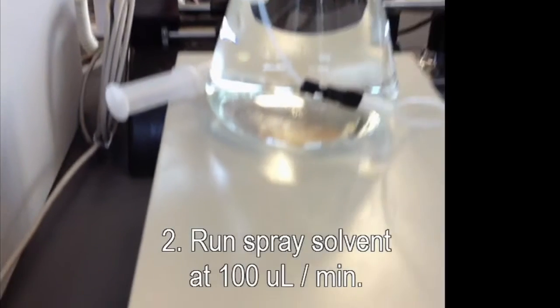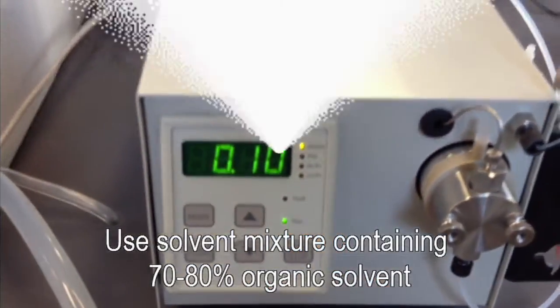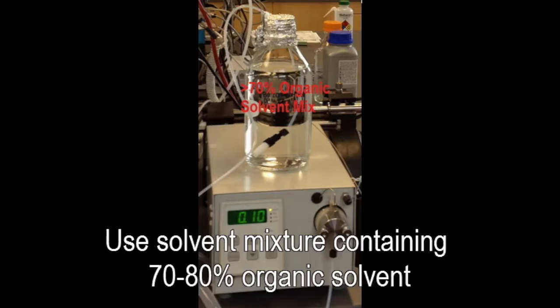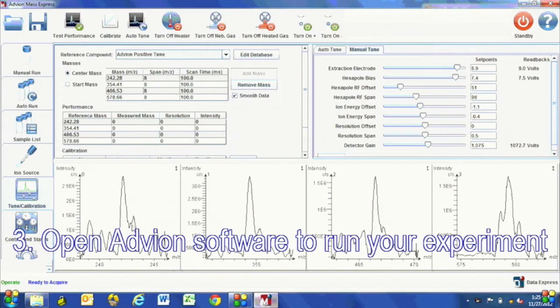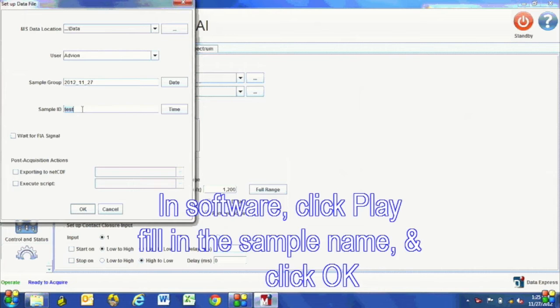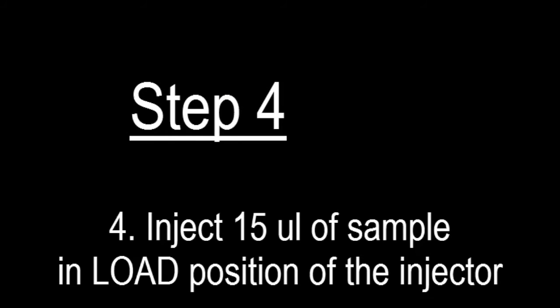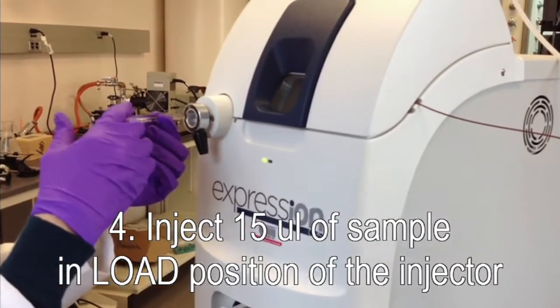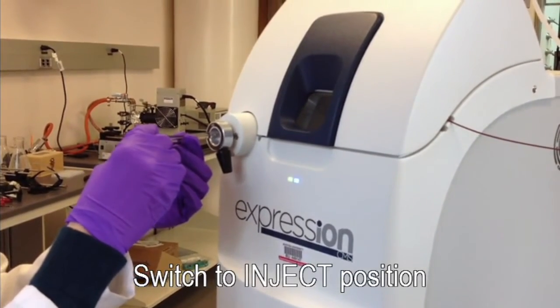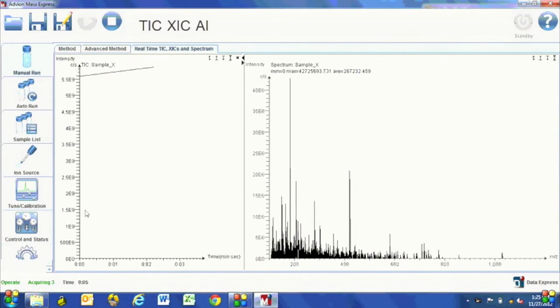Next, run spray solvent and acquire data using the Mass Express software. Inject your sample into the Expression CMS. Once you've injected your sample, switch the valve to the inject position.